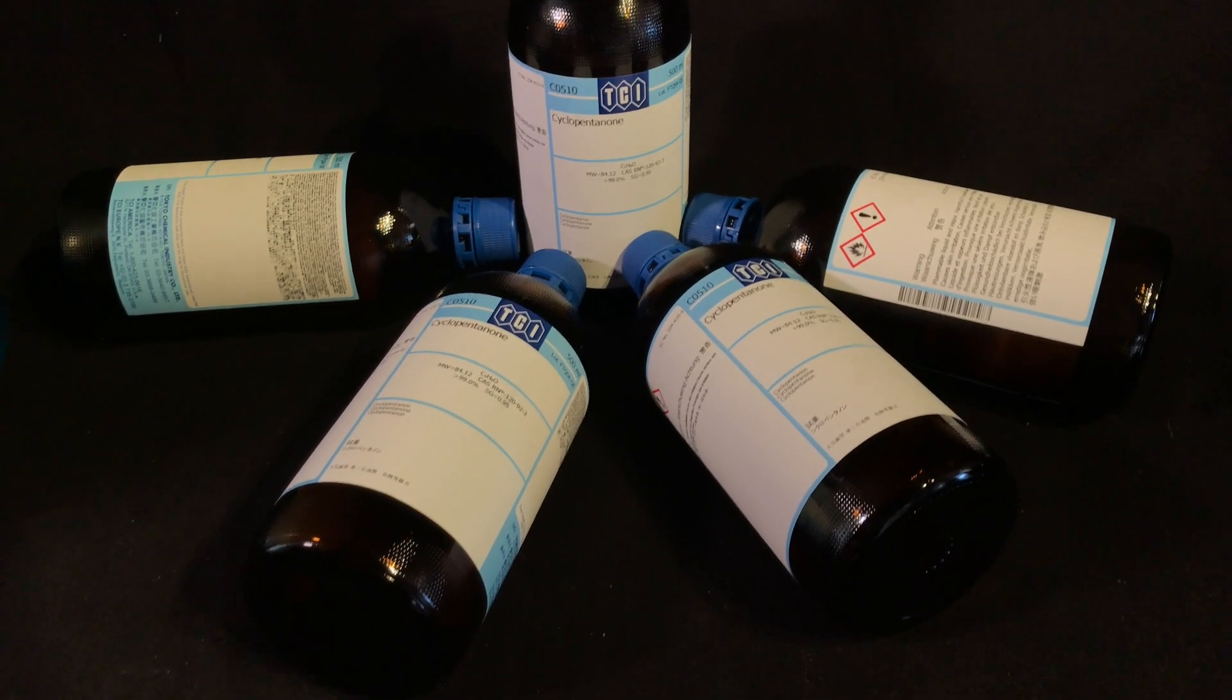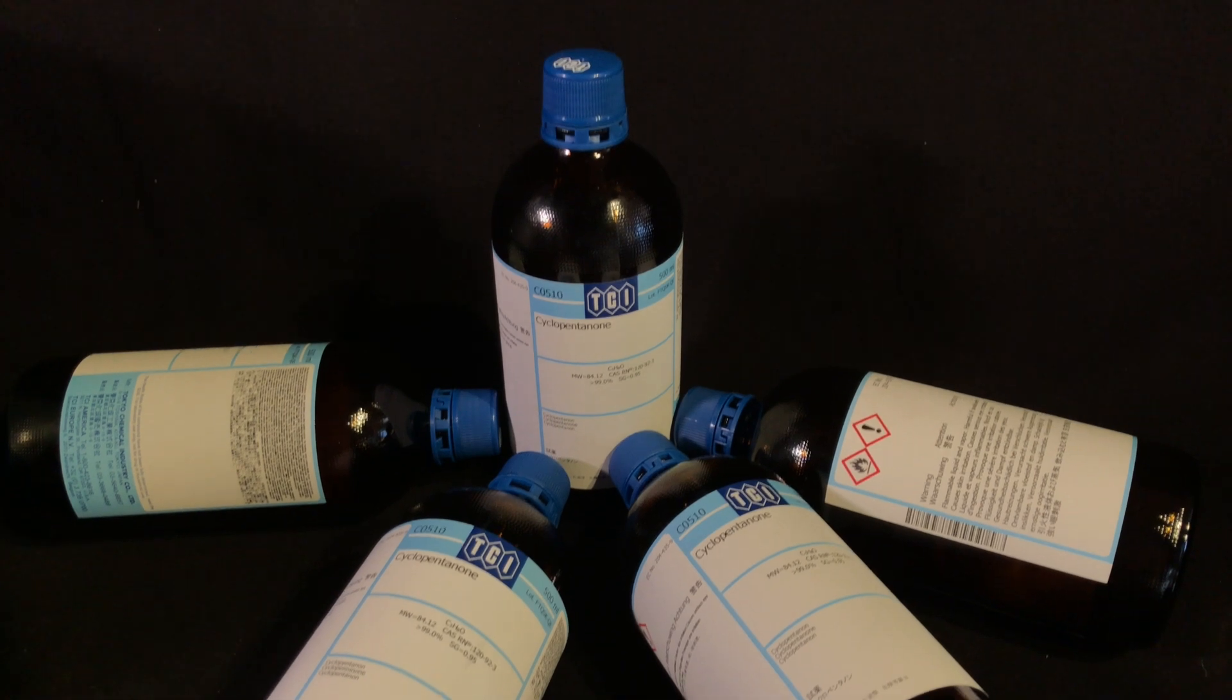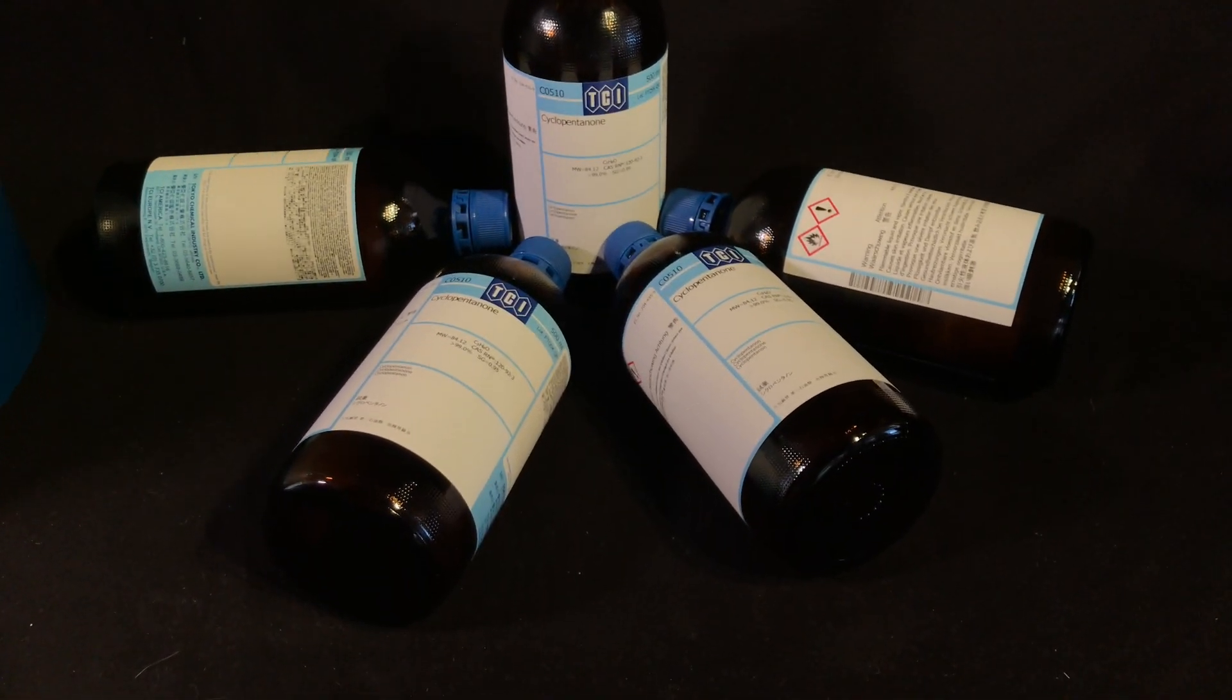In total we used a little more than 2 liters of cyclopentanone. The empty bottles will be kept and I'm going to use them for other chemicals.